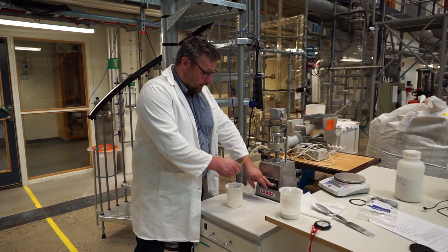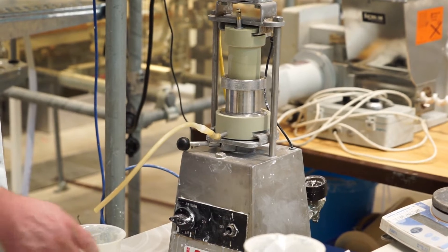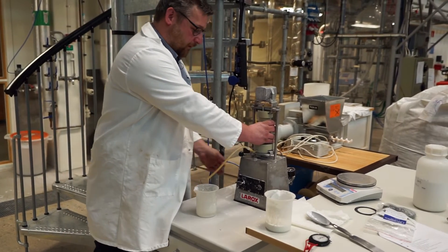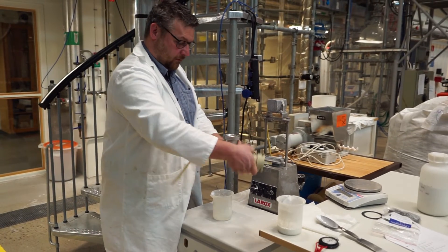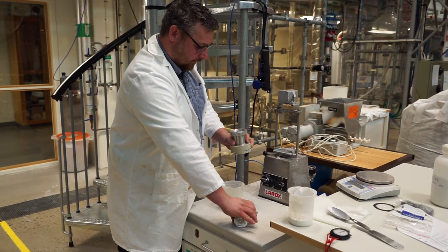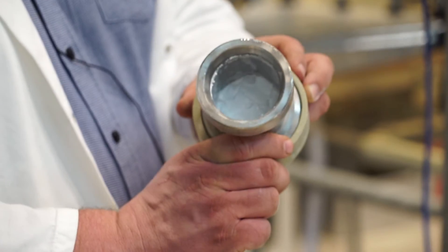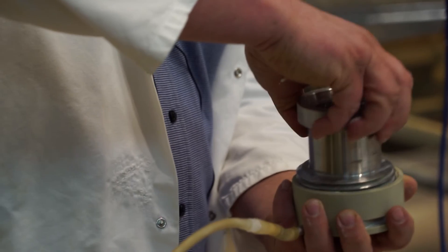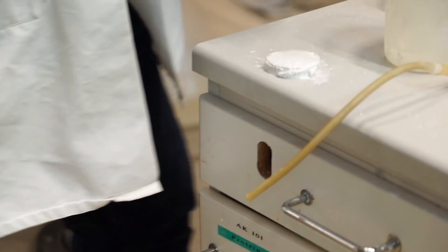So basically we release the piston. Yeah, so you see that goes down now there. And remove the little thing here in the back. Okay, pull everything out. Remove the piston. And here's our filter cake. So now we take it apart. And please note when you do this lab that liquid can pour out from the tube and whatever. And then we drop the filter cake. So there you can see the filter cake.